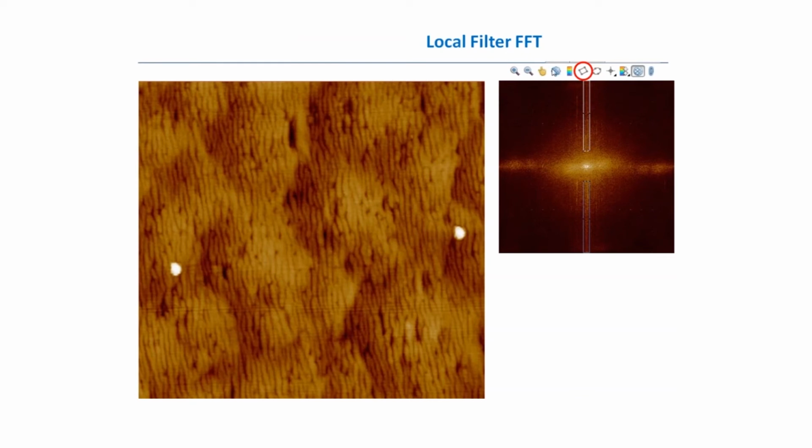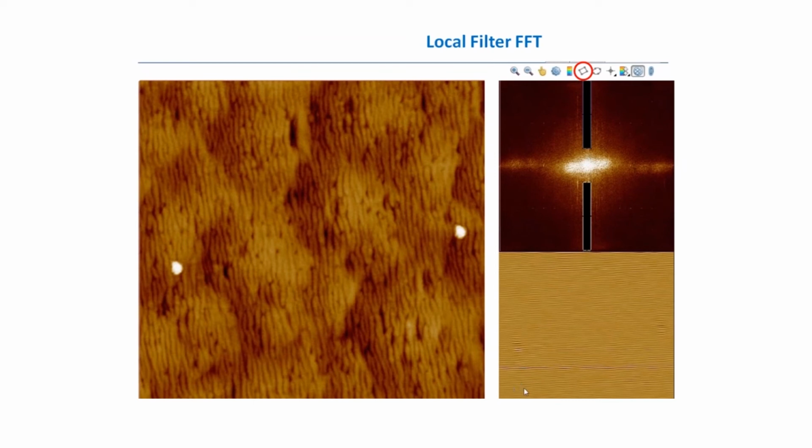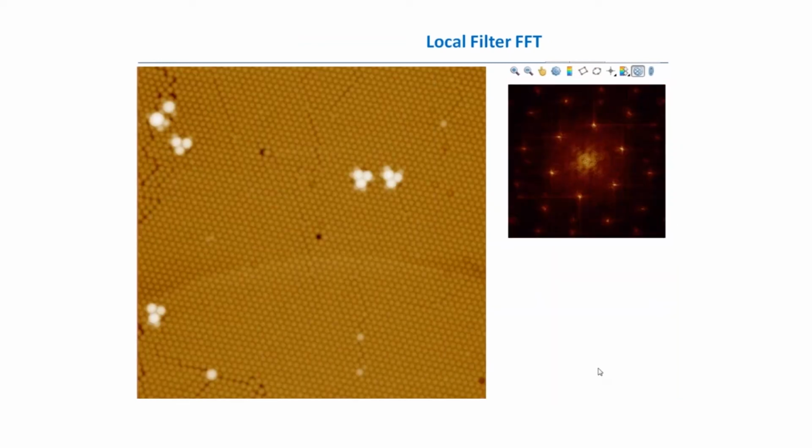In this example, from the right side we see the spectrum of this image, and we see that there are some frequencies which lie at the top and bottom of the main spectrum. This means that these frequencies correspond to something which is periodic in a vertical direction. And these lines also have some vertical periodicity. Using the local filter tab and the rectangular selection tool, we choose these frequencies, and when we apply this filter, deleting these frequencies, we can see that these annoying lines disappeared from our original image, and in the end we start to see them in the difference image.